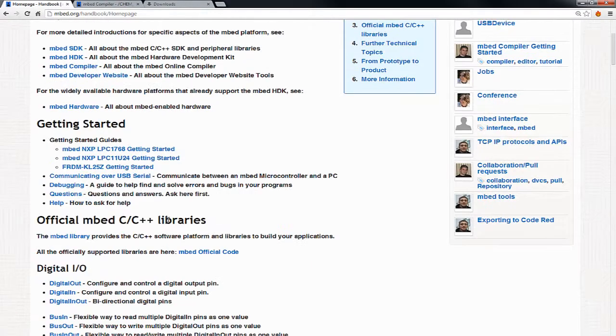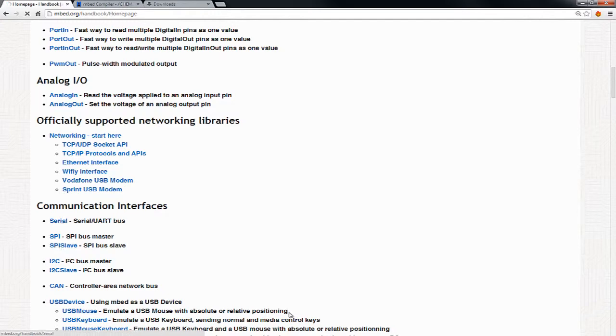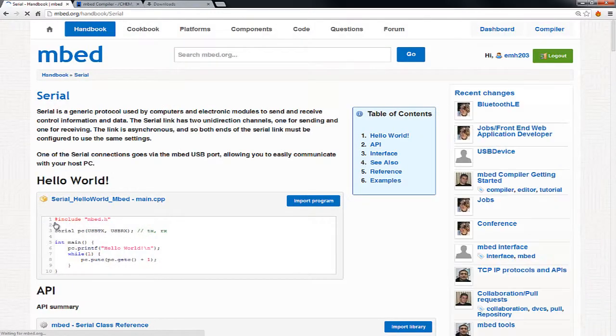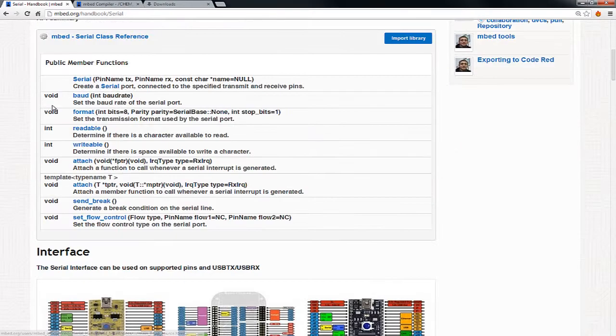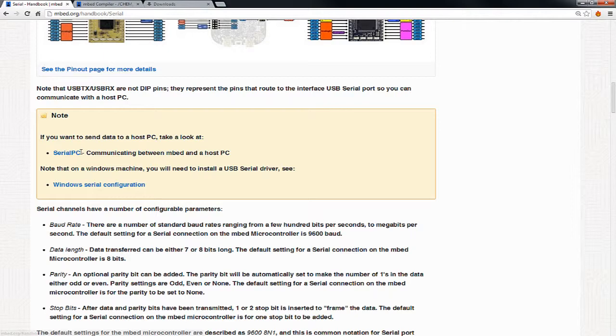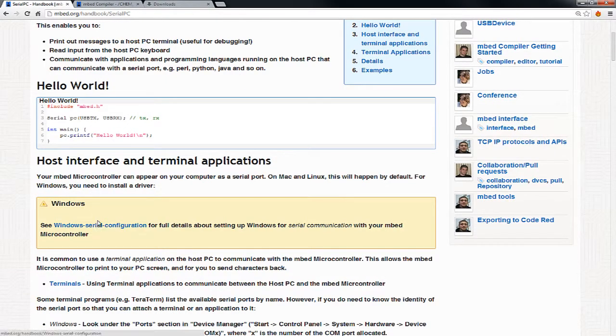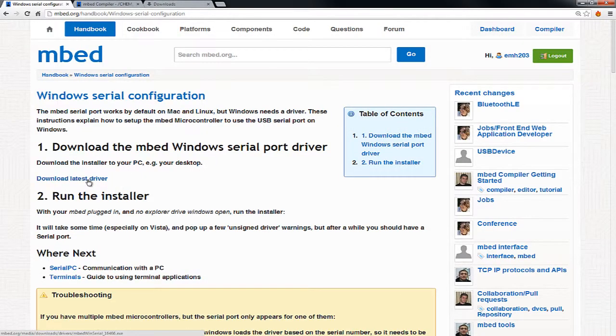Not only can the mbed look like a thumb drive, but it can also look like what's called a virtual serial port, where it'll look like a serial port inside of the Windows Explorer. So you can talk to it from a PC. But what you've got to do to get it to work is, on the mbed handbook serial page, there's a driver. I'll click on Serial PC, and it has a link to the driver. You've got to run this driver.